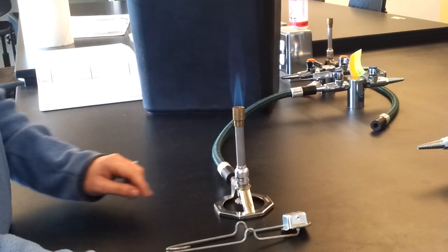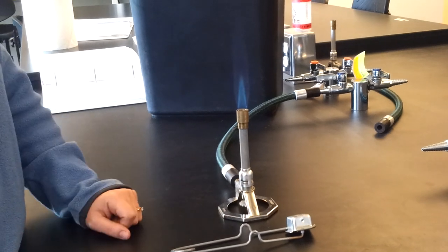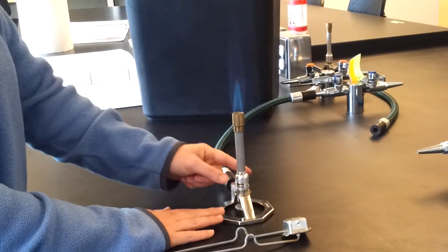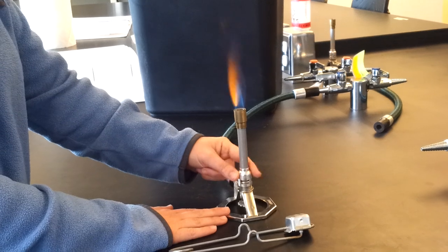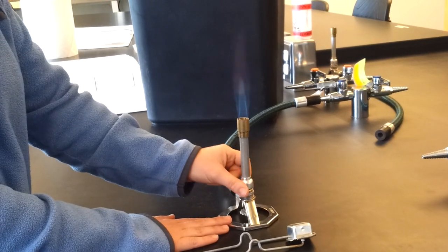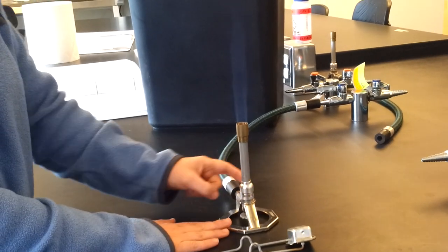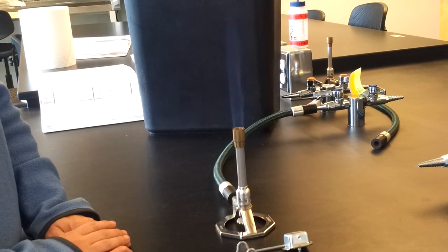A problem would be, though, is if there was too much air coming through the Bunsen burner, and this is called the barrel, and it twists. You can see what would happen if this would be a bad flame. See, you can't see an inner blue cone.